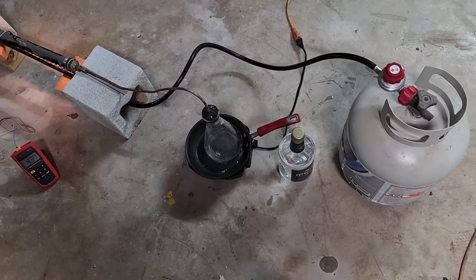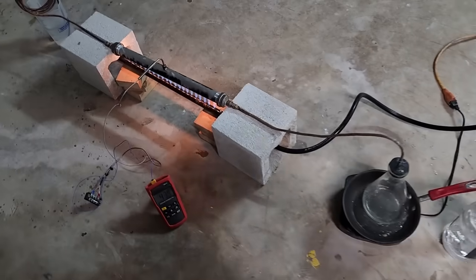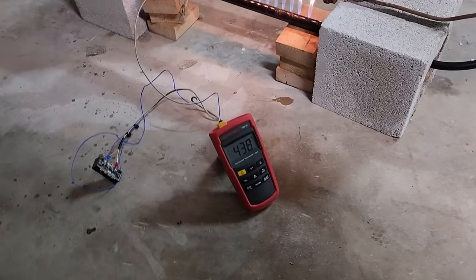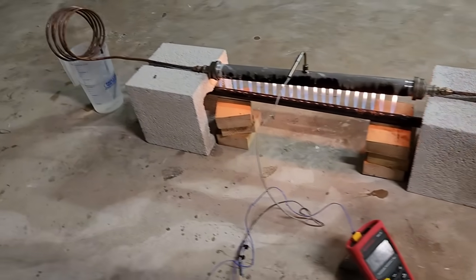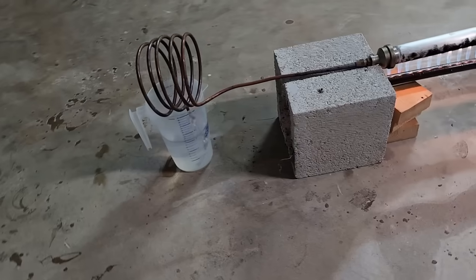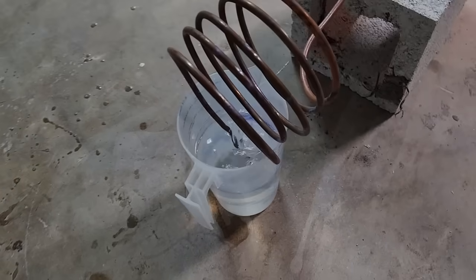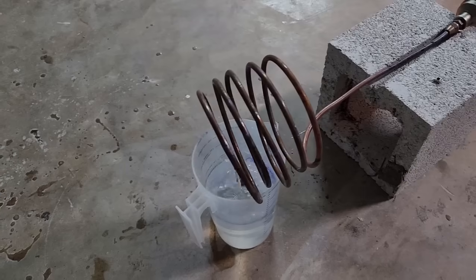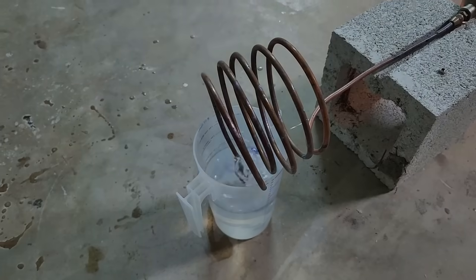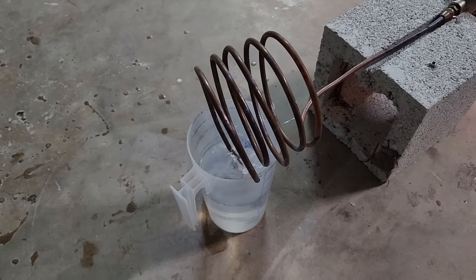Here's the crude setup for a quick test. After 10 to 15 minutes, I got the catalyst heated to the target temperature and the ethanol was boiling. As you can see, it's flowing a lot of gas through this makeshift bubbler, which should be ethylene. The output must be pretty good, because every few seconds I'm able to light off a pretty decent sized plume of fire.